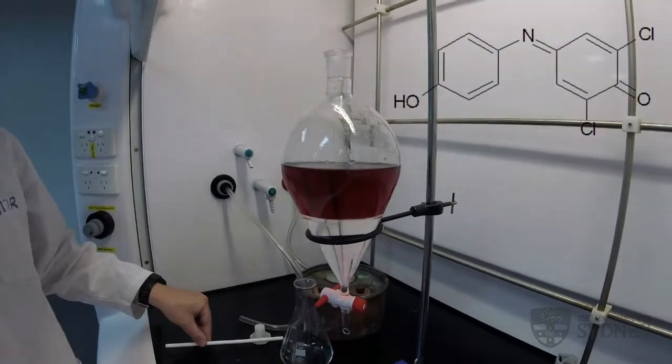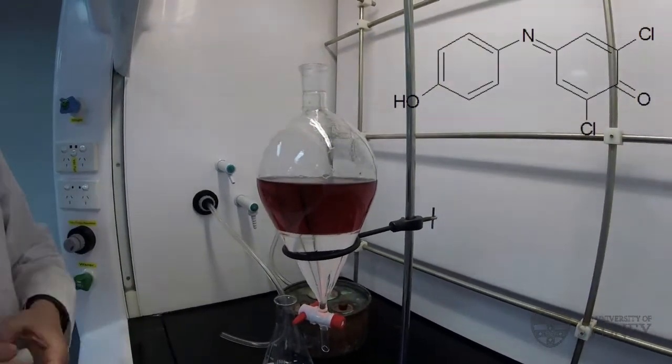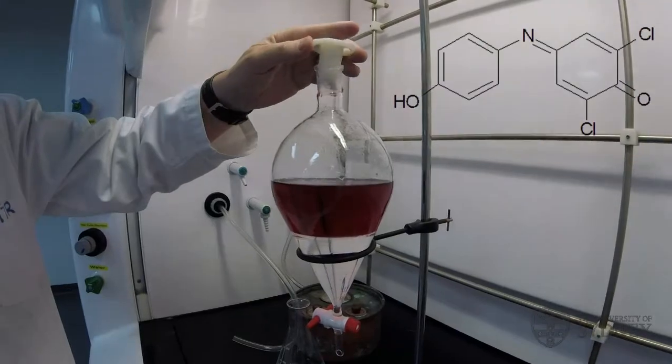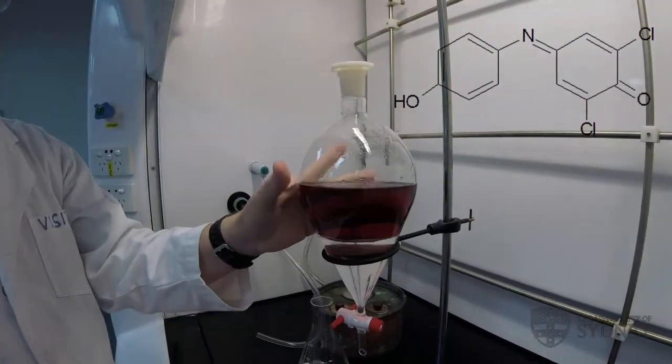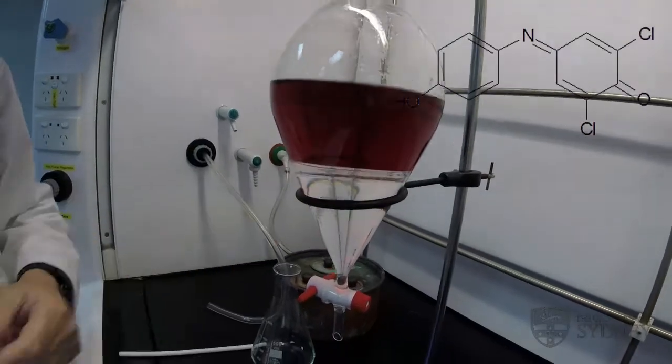Okay, so there we have it: the red, neutral, acidic form of our indicator. Now we expect this neutral species to be soluble in the organic layer, so it should extract into here.